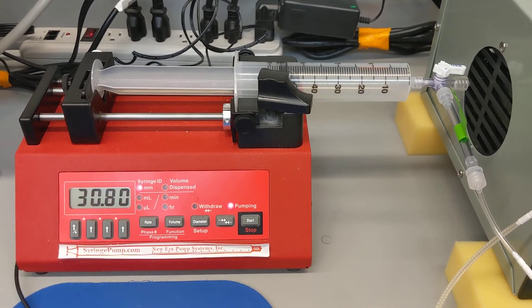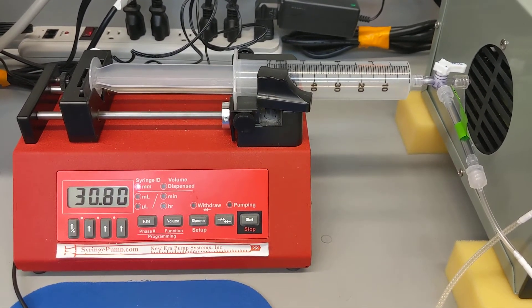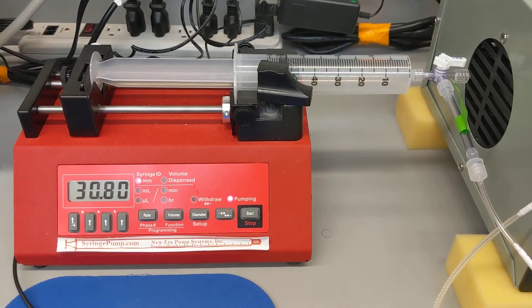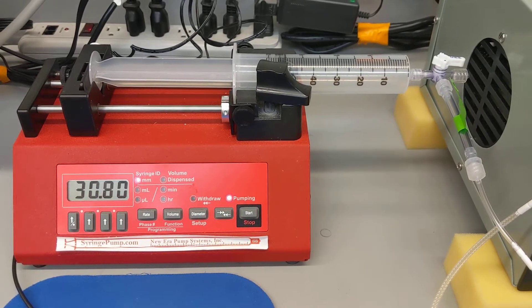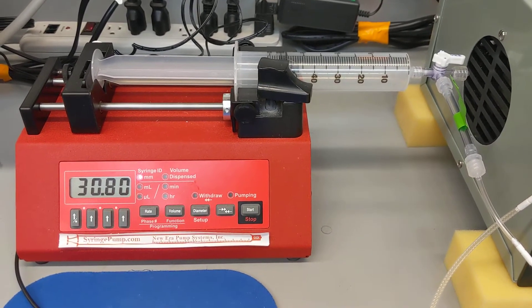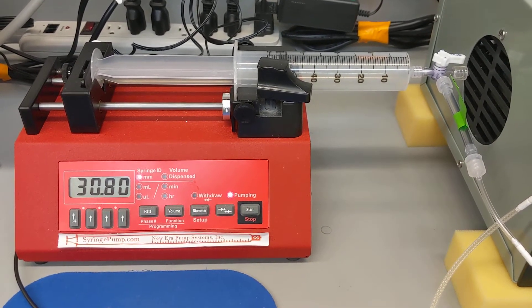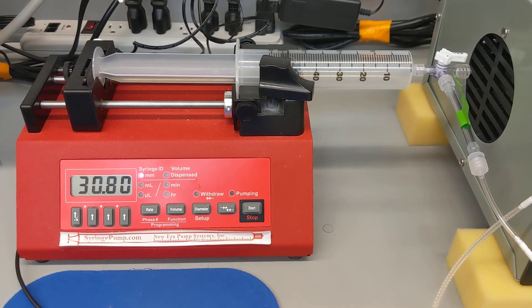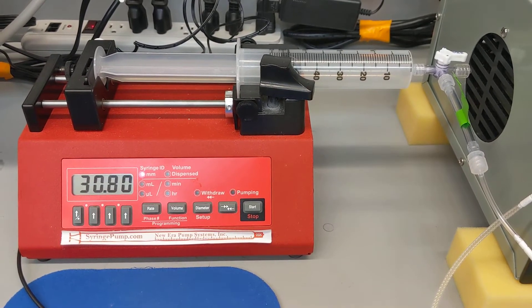And this is going to pump the air sample through the system and effectively do the same thing as I showed you previously, but now we're pushing a sample through rather than pulling it through.